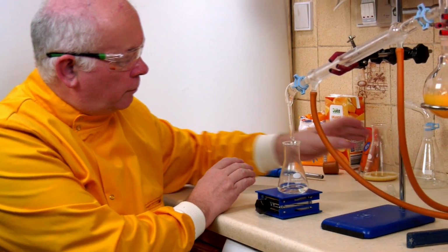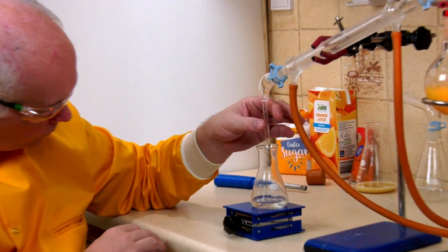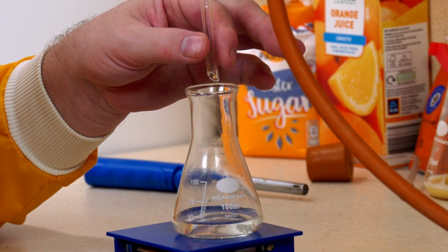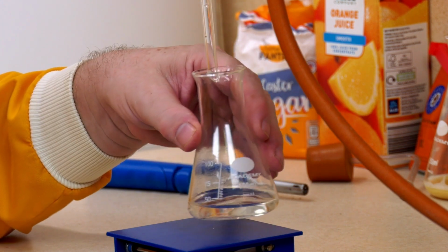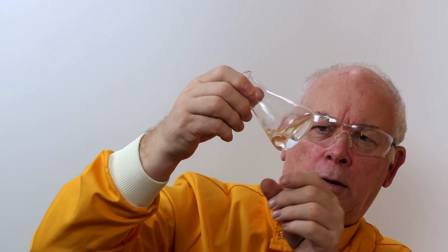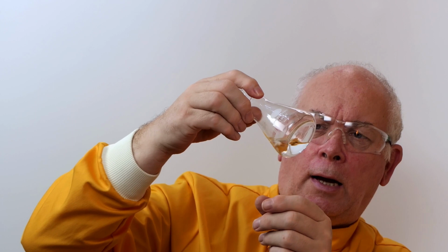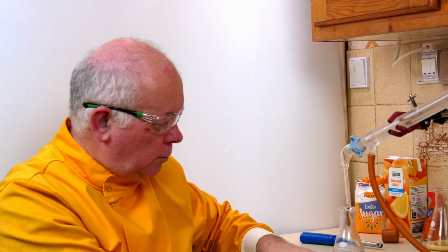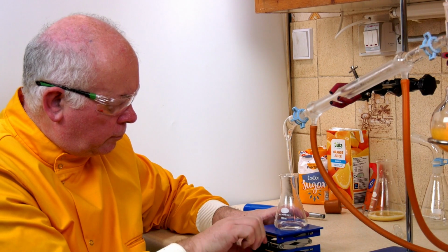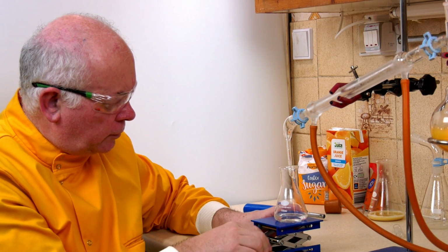Yeah, I'll leave that there. This is just about stopped. And hopefully here we have a small amount of alcohol made, which has a slight aroma of orange juice, which is not really that surprising. I'll wind this up so it can collect the rest.